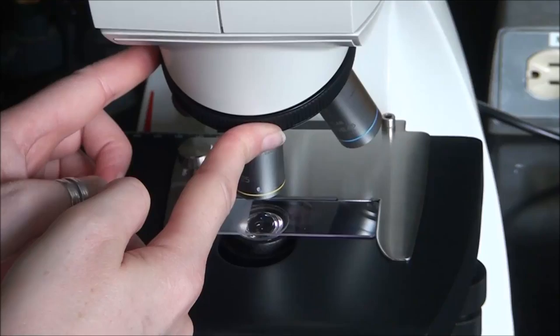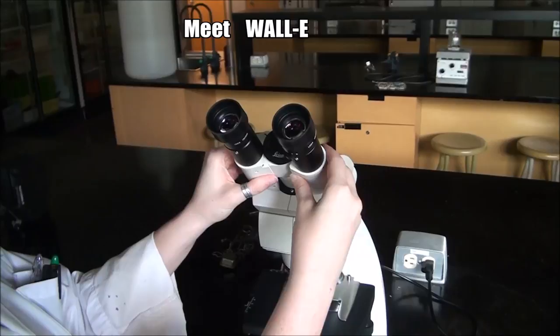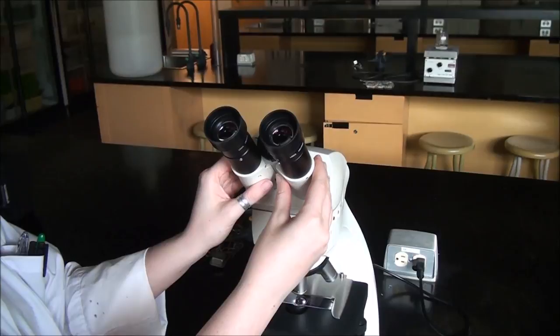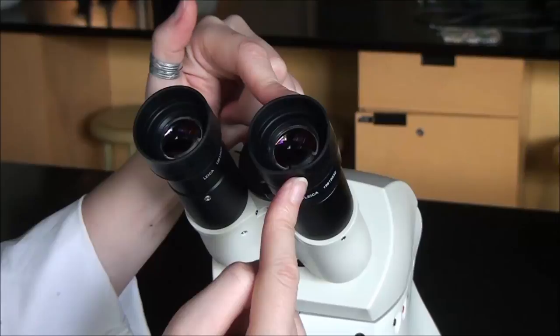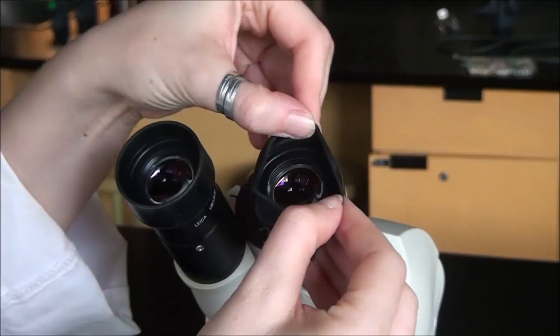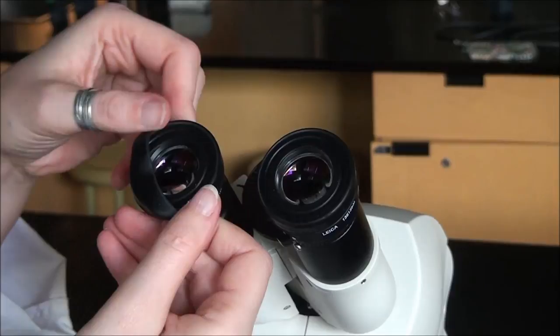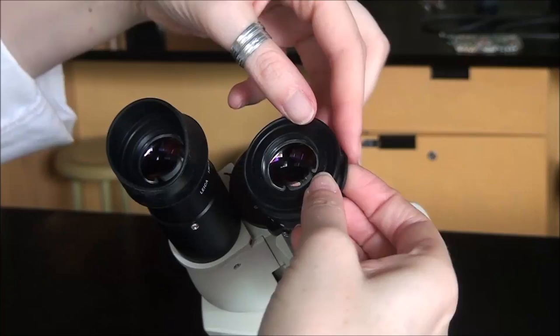These binoculars can move out or come together depending on the width of your eyes. If you have contacts or you don't need glasses, you'll notice there are these rubber bits up top. You can leave those just as they are. If you wear prescription glasses or lab glasses, you can fold those out of the way. Since I don't wear glasses, I'm going to fold them back up.